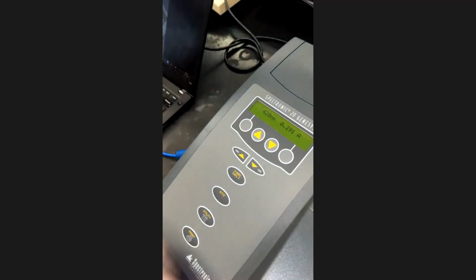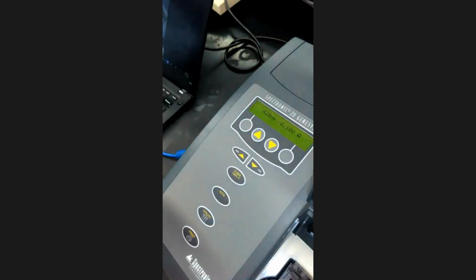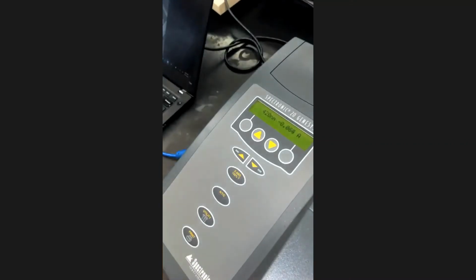All right, there we go. At this point, I have collected the data from all of my samples, and as you've been able to see, I actually got an increasing amount of absorbance as I went through, which is a result of increasing amounts of yellow. I'm going to try to show you the tubes over here.